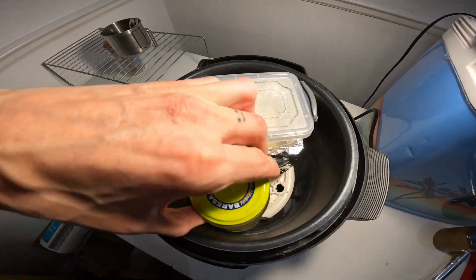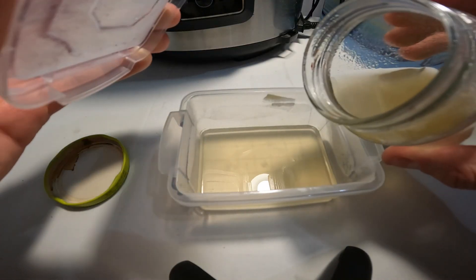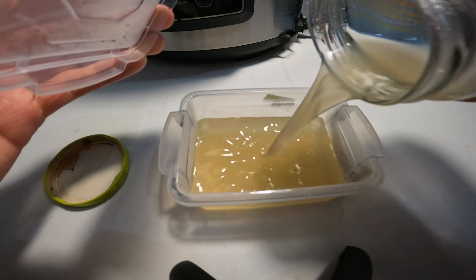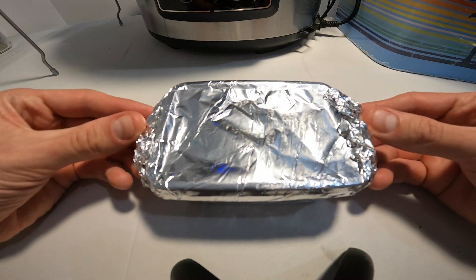And I discovered that I don't actually have space for everything that I've poured. But this isn't an issue because I'm sure you wanted to see me transferring more liquids between containers anyway. With the jar now emptied into the larger pot, it was now put in disguise and into the pressure pot.